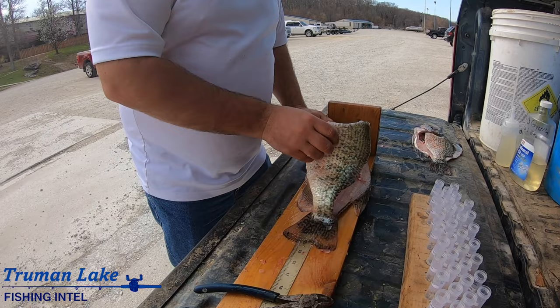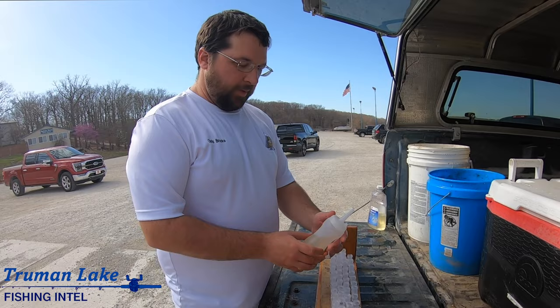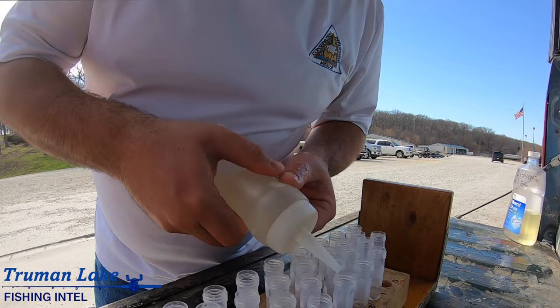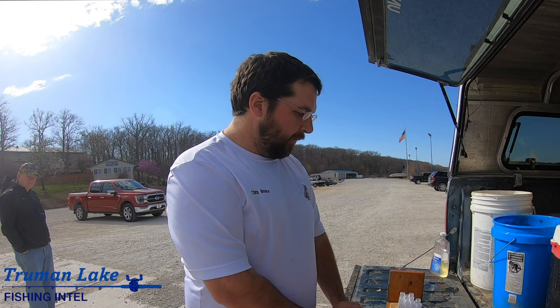14.6. Once we pulled all the otoliths - we've got 30 here - I'll put a little bit of this mixture of glycerin and ethanol: three parts glycerin, two parts ethanol. All this does is make the rings show up better when you put them under the microscope. I just dab just enough to cover them up, we'll wait and let them sit for a week or two and then they'll show up a lot better.